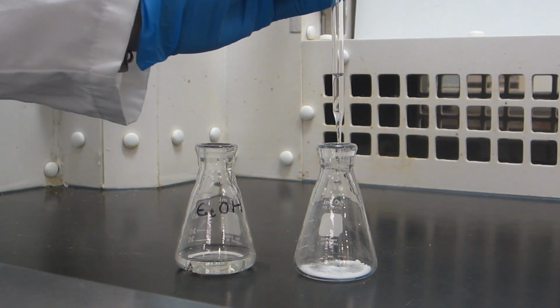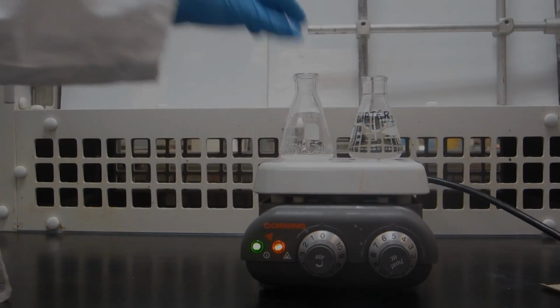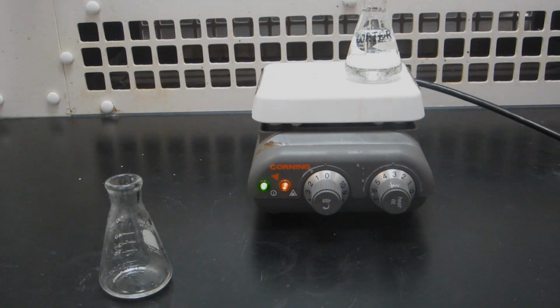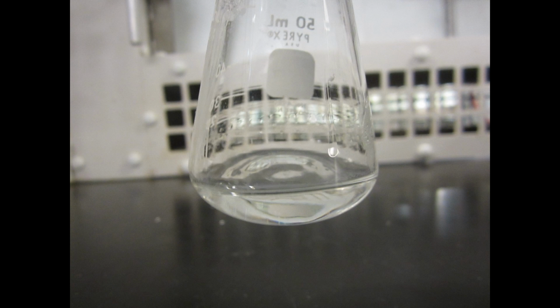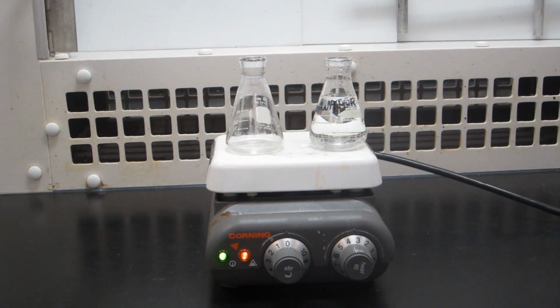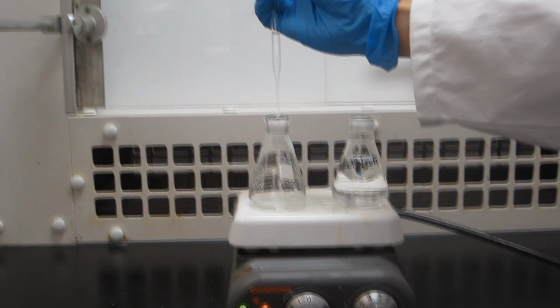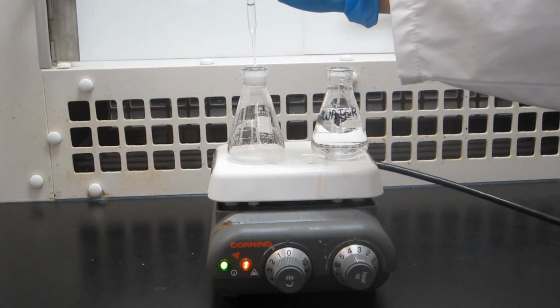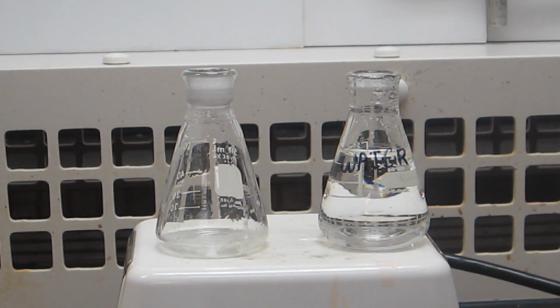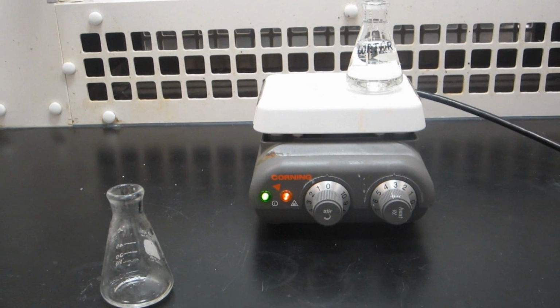Add about 1.5 milliliters of ethanol to the sample and begin warming on the hot plate. If the sample dissolves upon heating, do not add more solvent and remove the hot solution from the hot plate. You can confirm that all of the solids have dissolved when the remaining solution is clear, but not necessarily colorless. If the solids have not dissolved, very slowly add water, about 1 milliliter at a time, to a maximum of 10 milliliters. If the solid still has not dissolved, add more ethanol, 1 milliliter at a time, to a maximum of 5 milliliters. Once the solid has dissolved, stop adding solvent and remove the flask from the heat.